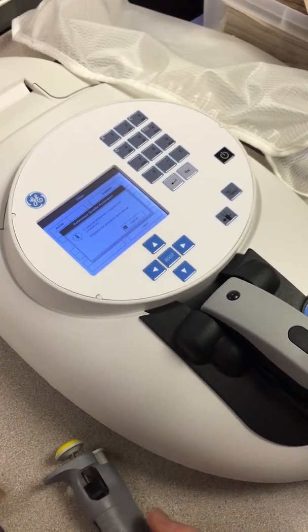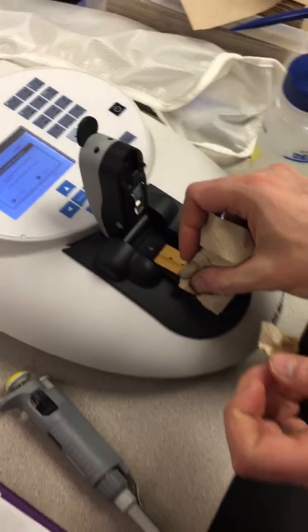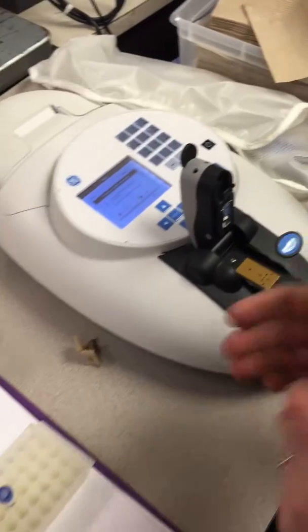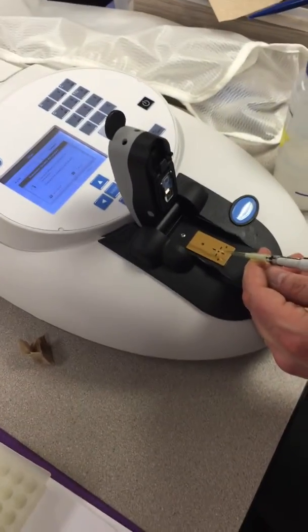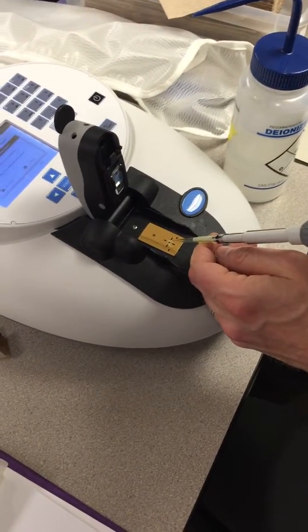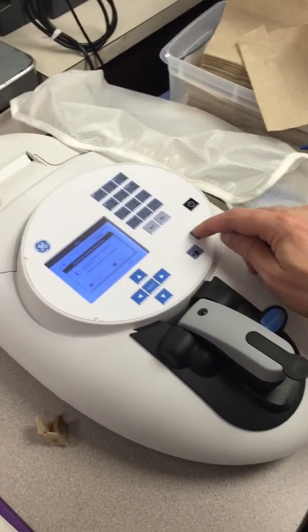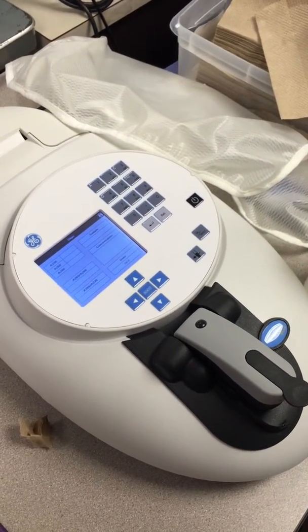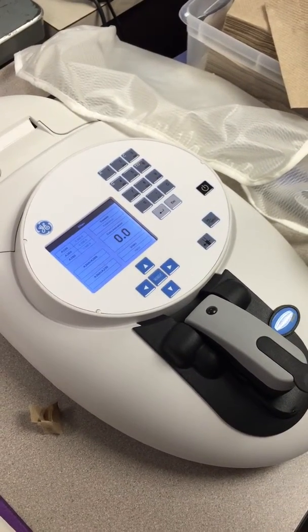Okay, second reference is required, so we're going to go ahead and do that. I'm going to remove this water here, and then I'm going to add 2 microliters of fresh deionized water to it. Put it on the, oops, try it again. Drop there, yeah, and then hit the button again. It sounds like an angry bug. But a really useful machine.